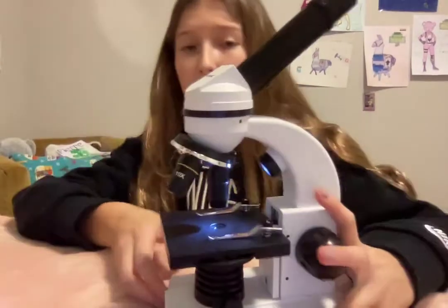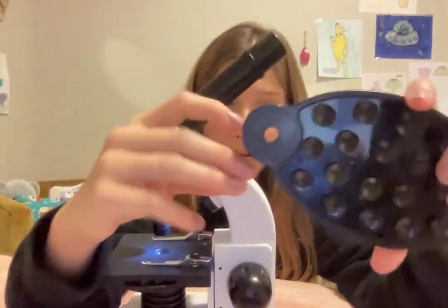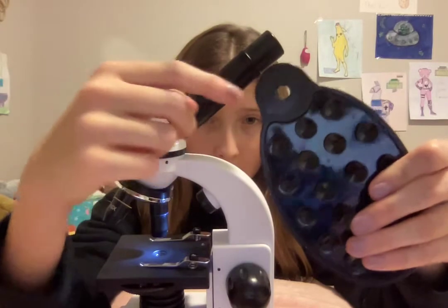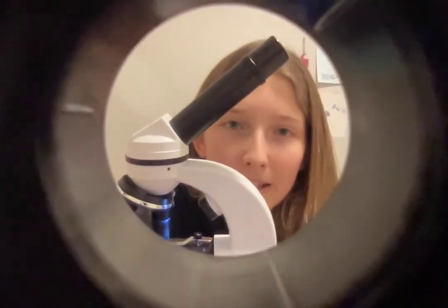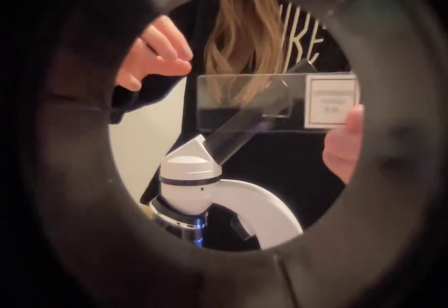I'm going to show you guys what it looks like through this with the phone. With the phone holder, I recommend only phones with one camera. If you have two cameras that might work, but three cameras is always hard because the third and second cameras stick out, and when you try to zoom in with one it switches to another and zooms out. You put it on — take the basic camera app and put the phone right on top of the eyepiece like this.